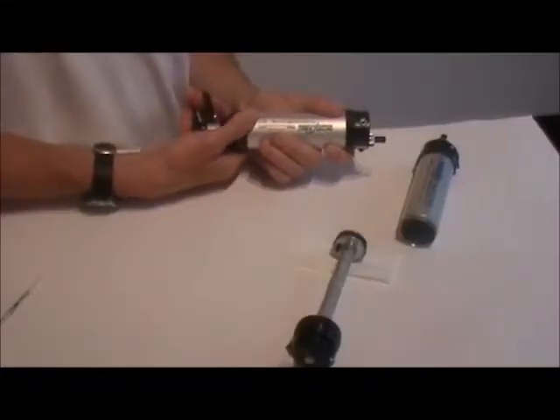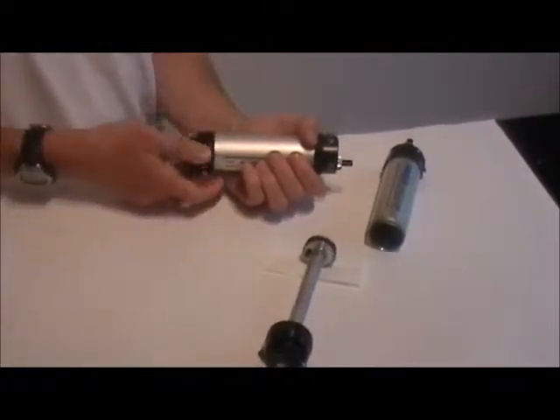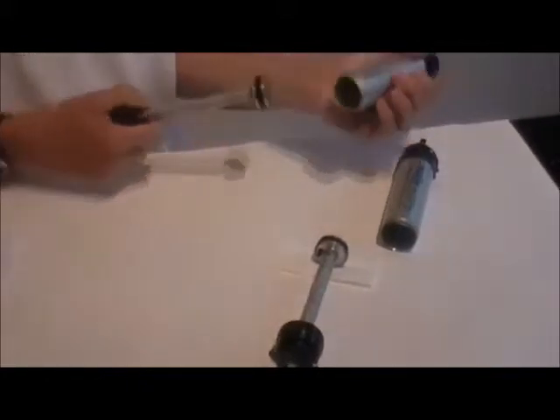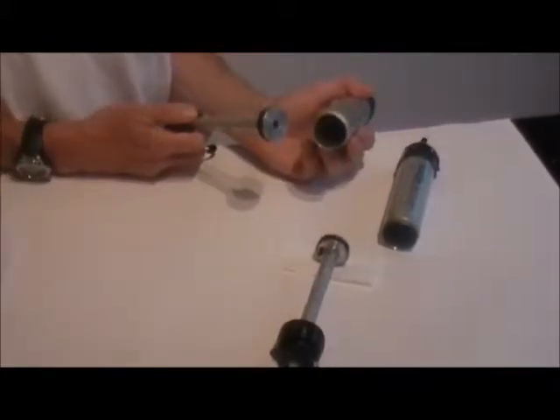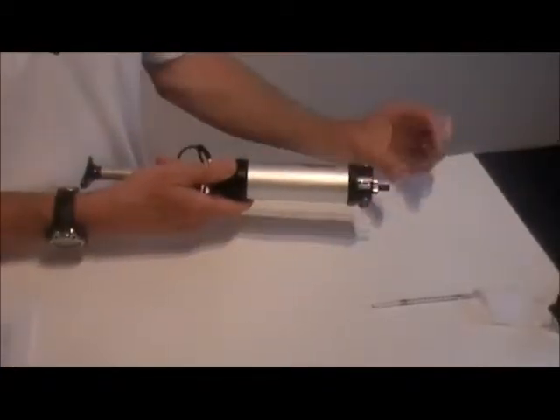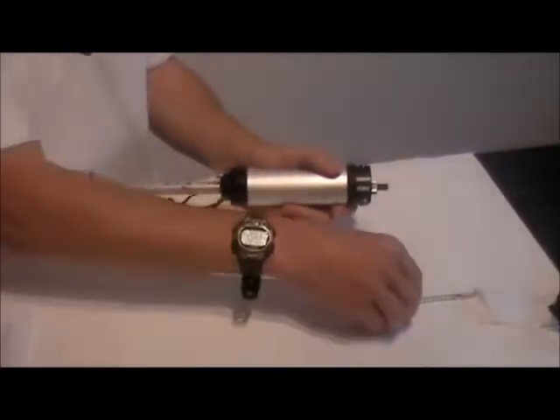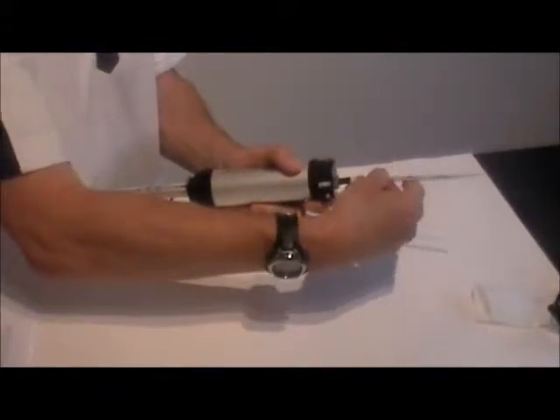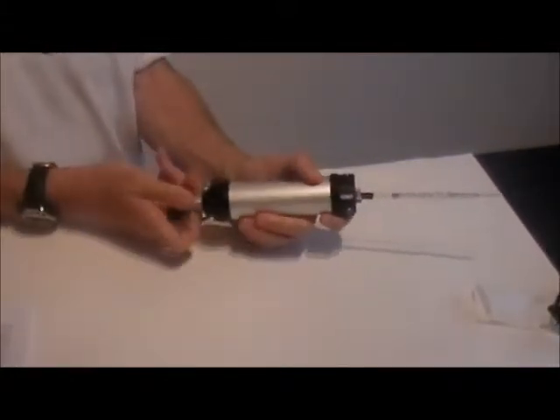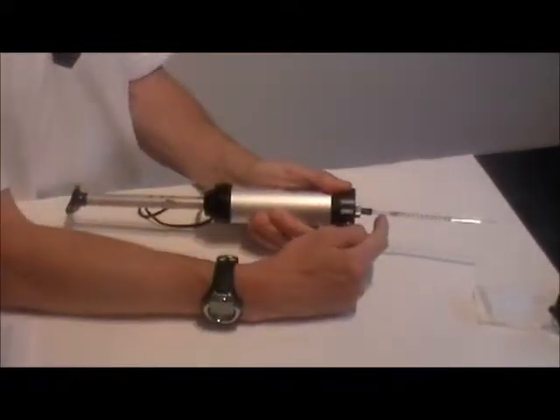Here's how the hand pump works. The hand pump has a piston and barrel design that holds a strong vacuum. The piston locks in place at 100 cc's. Without a tube in the inlet the chamber fills quickly. With the tube in the inlet it takes about a minute or two for the chamber to fill because of flow resistance within the tube, which controls the flow.